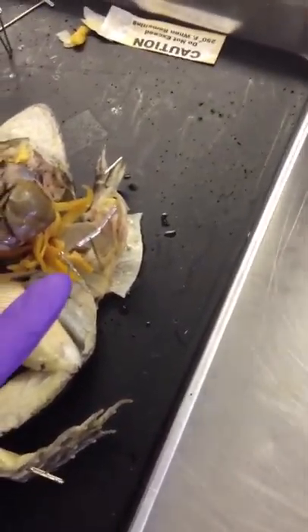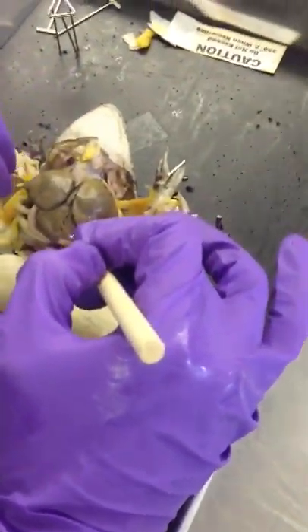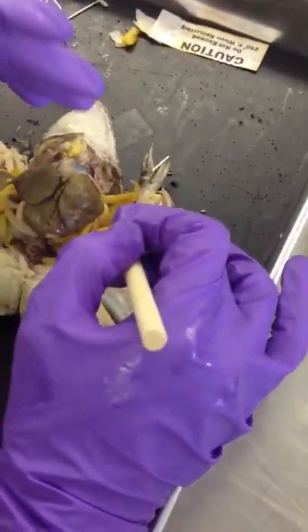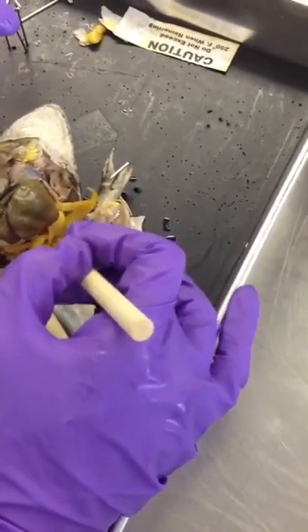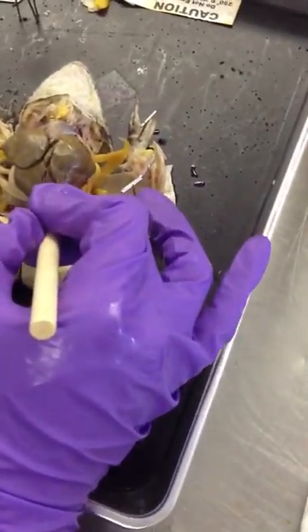What are these finger-like projections? Fat — those are called fat bodies, and we're only talking about frogs here. They're responsible for storage of fat. Are the fat bodies like the greater omentum? They serve the same purpose, except the greater omentum hangs from the stomach, whereas fat bodies hang from the body wall. Greater omentum serves a different purpose in humans and cats. These are just strictly fat bodies.